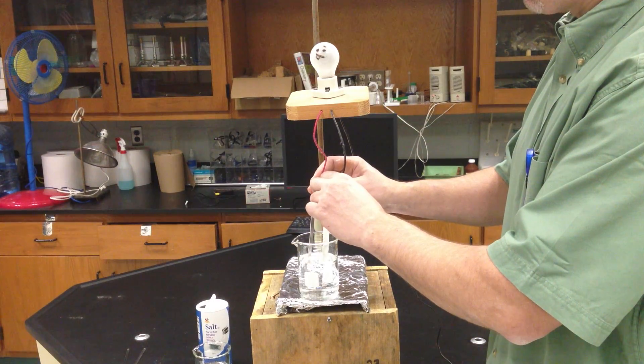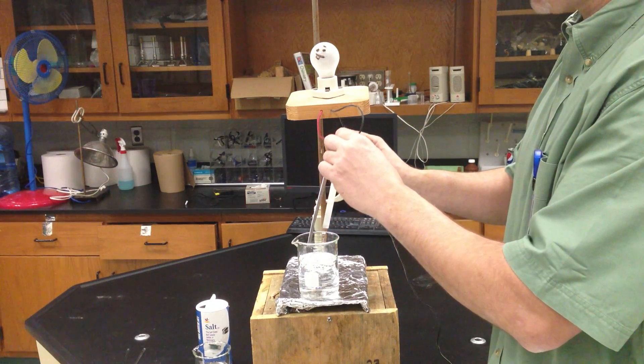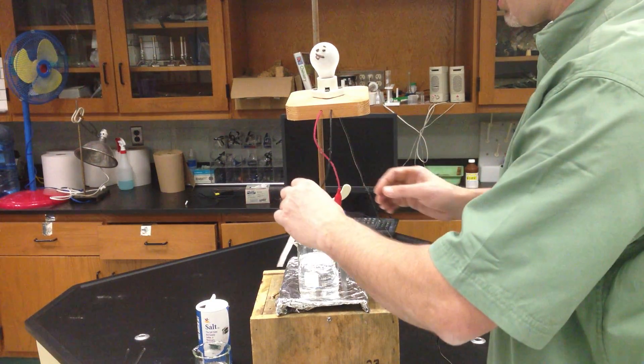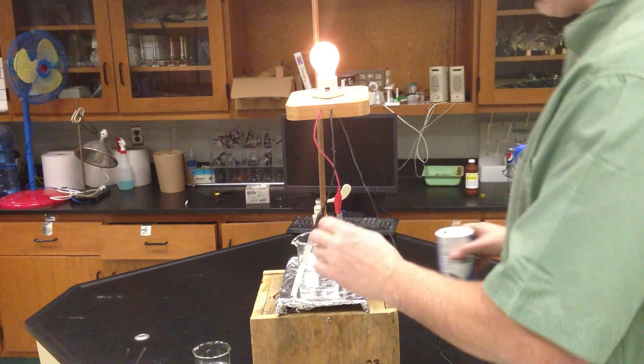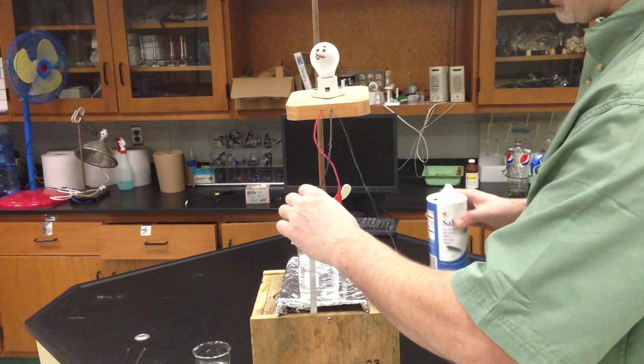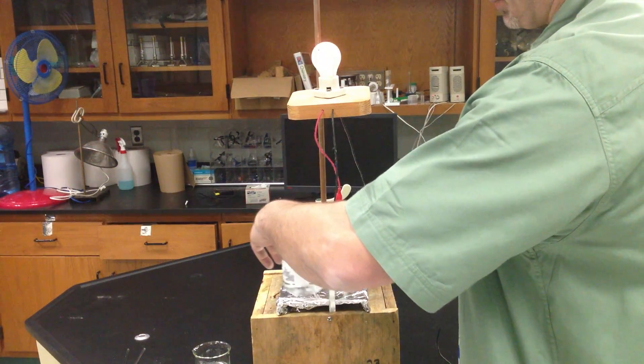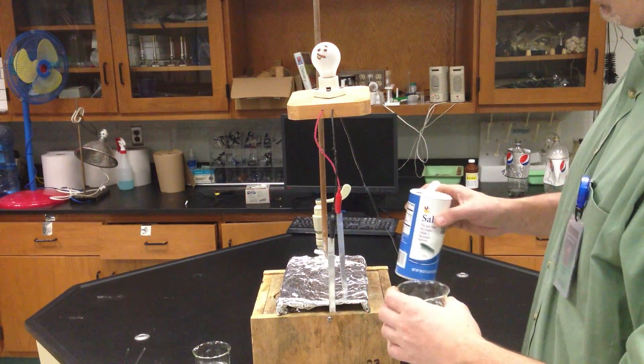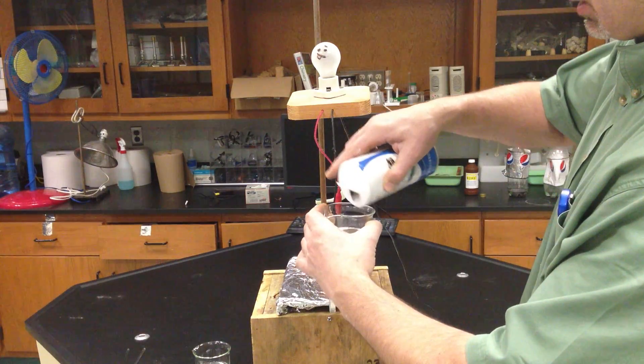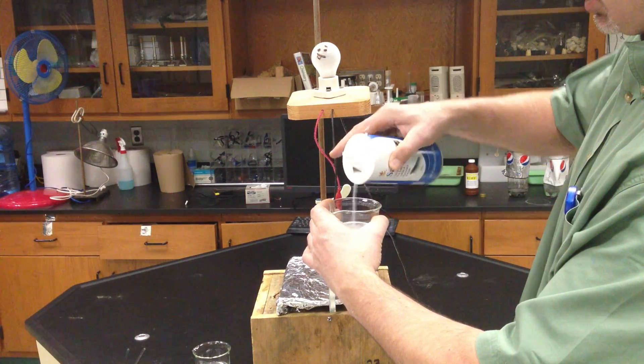It's only when we have free-moving ions in the water. So, I'm going to take this water and I'm going to add some... Oops! The reason why we're conducting here is I'm touching the metal top here. So I'm going to take this away. And again, I'm going to add some salt to my beaker.